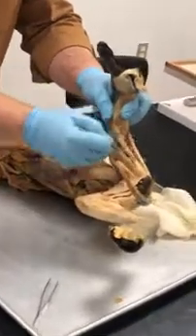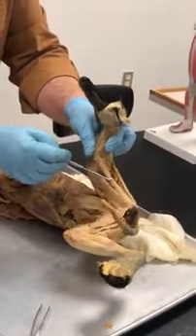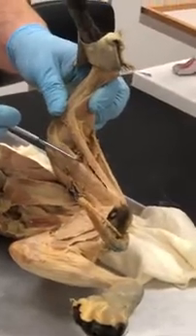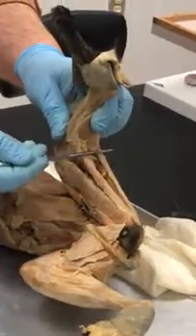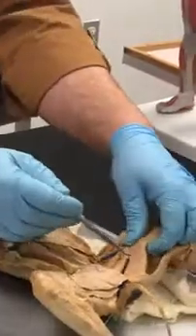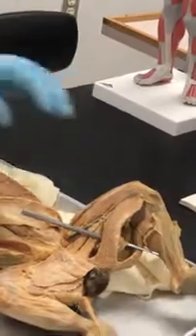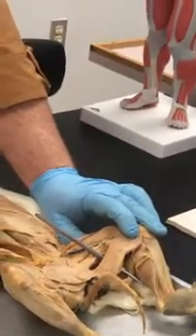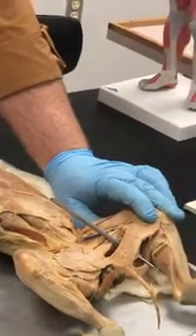So that's the biceps femoris over here. What's the one on the medial side that's superficial? Semitendinosus. And then the one that's deep to it? Semimembranosus. Now if you look at this angle, that's what it should look like on a human. But look what's happening. Here's the semitendinosus, and here's the semimembranosus. You're looking at it at a different angle. That's thick. Okay? So you could actually see it really nicely on the medial aspect of the thigh. All right? But it's all where they're supposed to be. They're just different shapes. Okay?